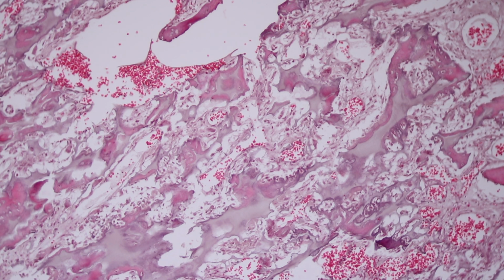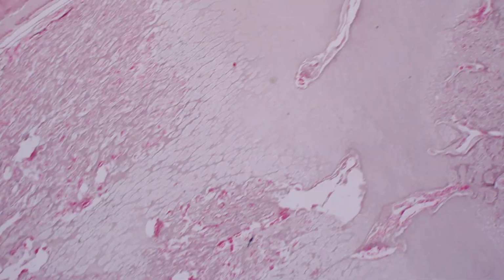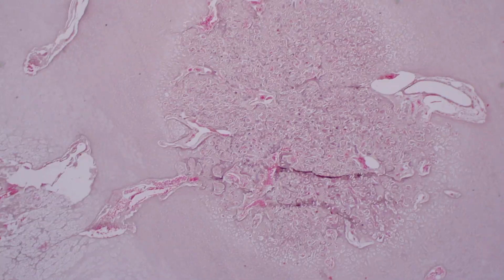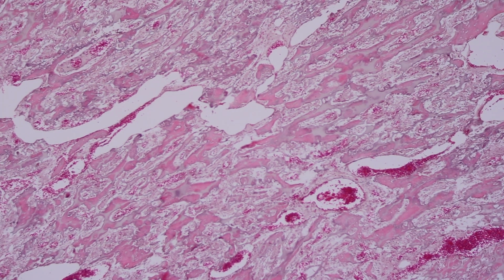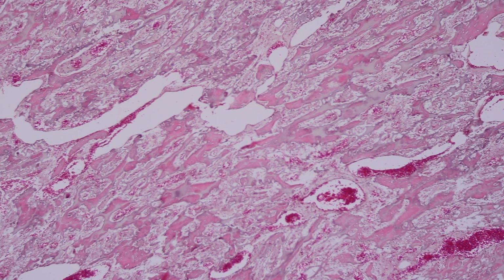This results in extramedullary hematopoiesis, where hematopoiesis will begin to develop within the liver and spleen. Here is our cartilage analog of the epiphysis. A secondary center of ossification has formed. This is the region of the growth plate where primary spongiosa is developing and is not being resorbed. You can imagine what the x-ray would look like in a case like this. The cartilage is mineralized, the bone is mineralized, so the bone would show increased radiodensity on imaging studies.